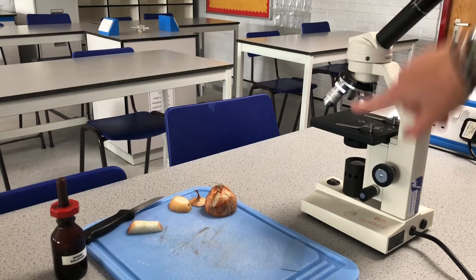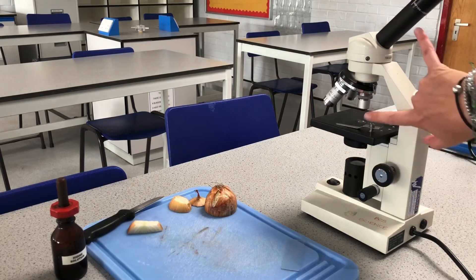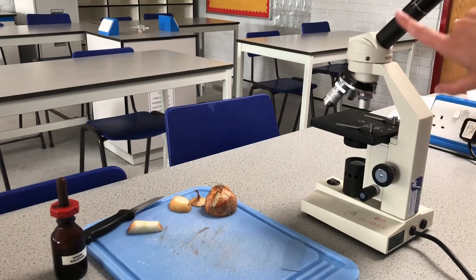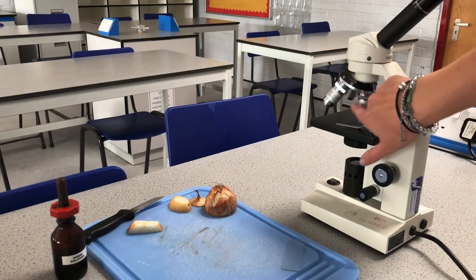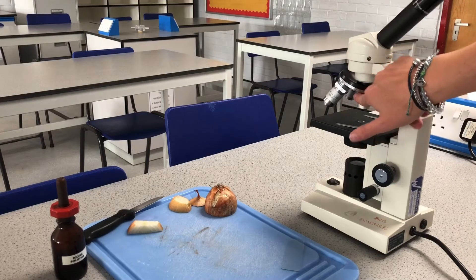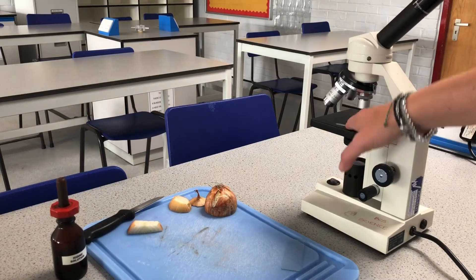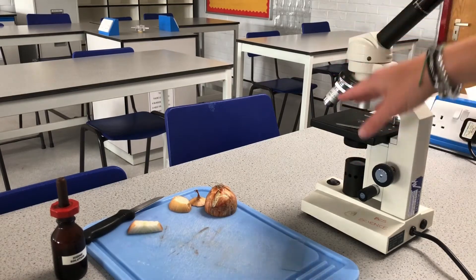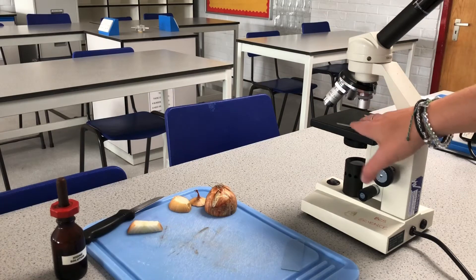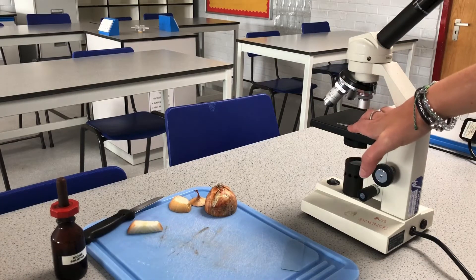In the eyepiece lens we have a times ten magnification, and down here I've got times four on the objective. Using both at the same time: ten multiplied by four is forty, so what I'm seeing will be forty times more magnified than it really is. As I change the objective lens, that will change the magnification.